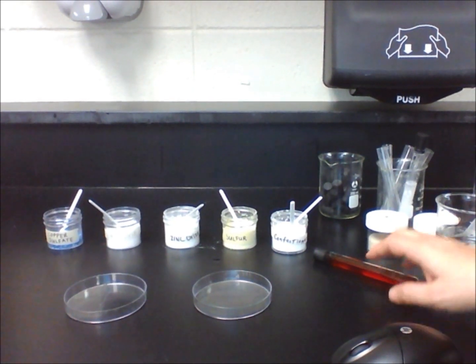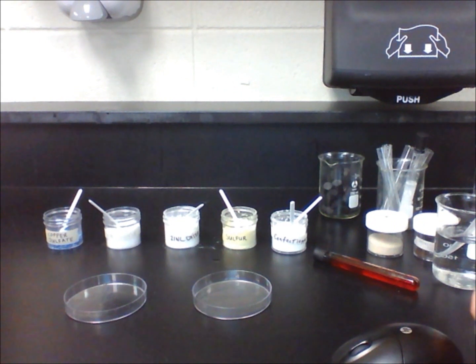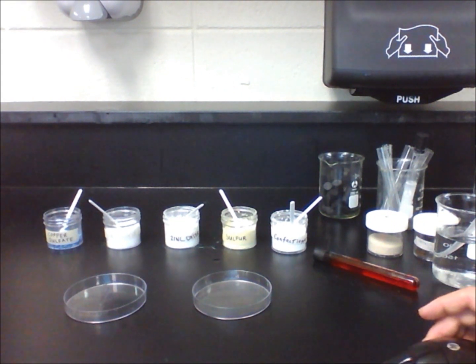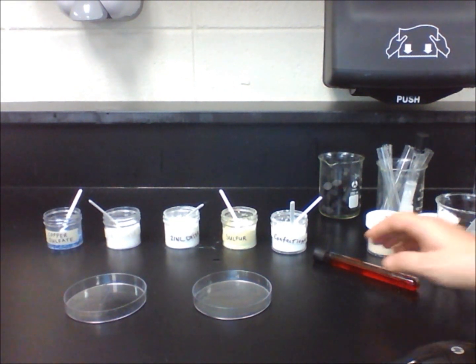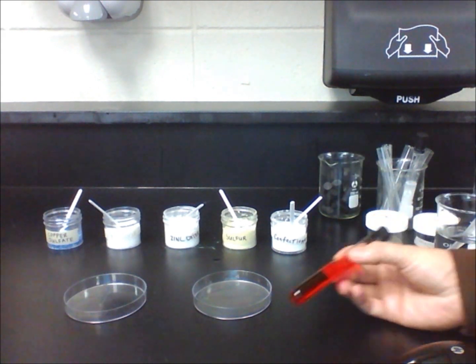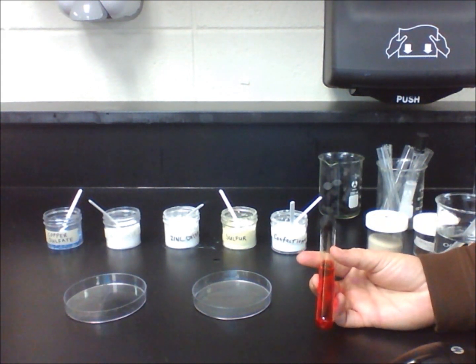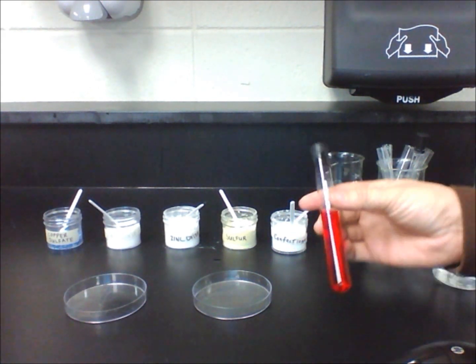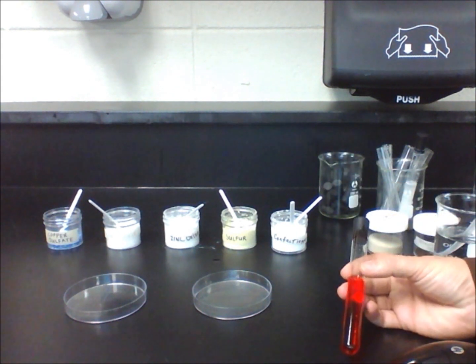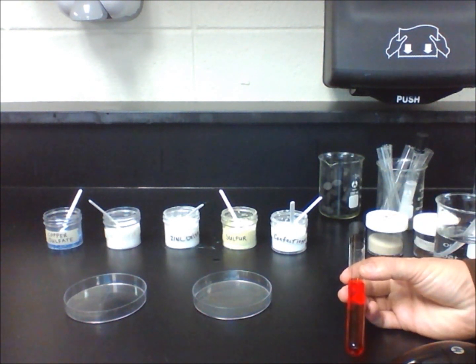In Lab 12, students investigate what happens when several pure substances are mixed with water. Using qualitative observations, students explain and identify characteristics of solutions by using keywords like dissolve, soluble, solute, solvent, and solution.